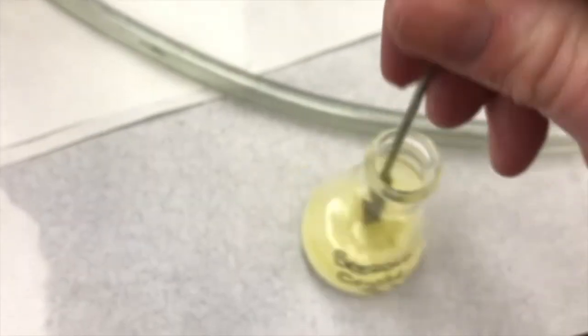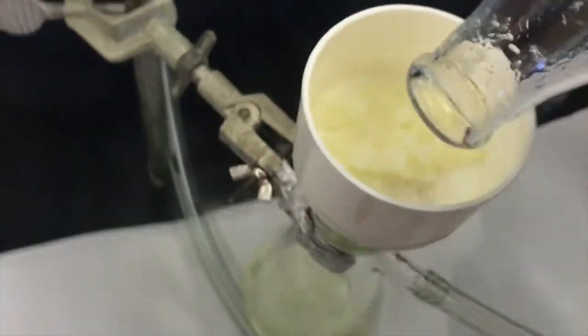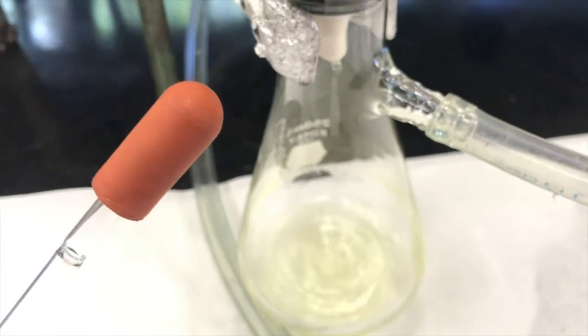Okay, looking pretty good. So now I'm going to go over to my flask and I'll stir it up to break up the crystals a little bit, so I can pour them out quickly. There we go. I'll swirl them around and quickly dump it into the middle. Give it a tap. Nice, good yield there, huh? See the mother liquor getting drawn through the filter paper.